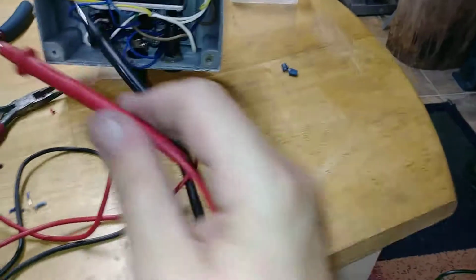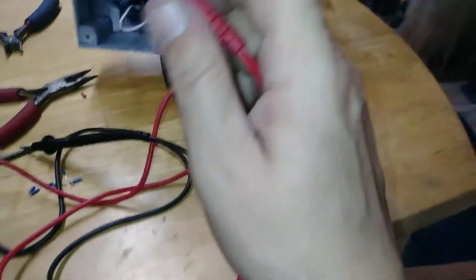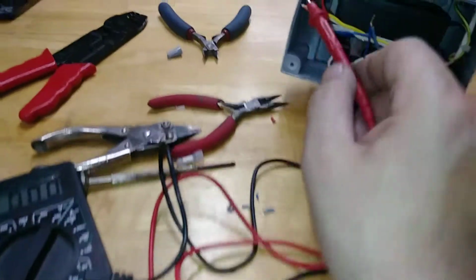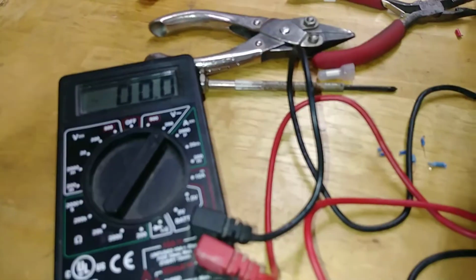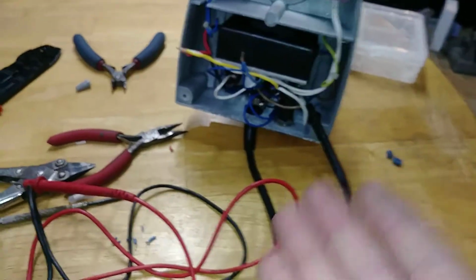So I don't understand why alternating current works this way. It shouldn't work this way. It should just be voltage no matter what. So for some reason, if I put the negative lead onto the hot rod and then touch it onto here, it shows voltage, but if I reverse it, it doesn't. And it shouldn't be that way with alternating current.